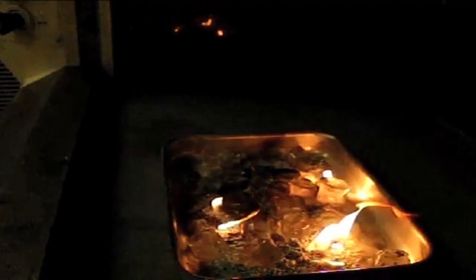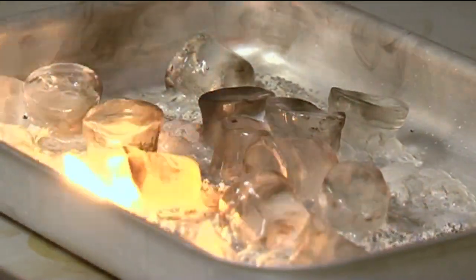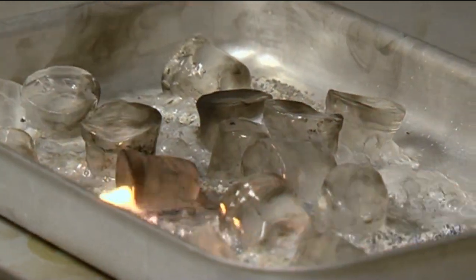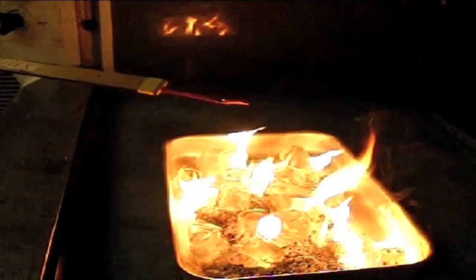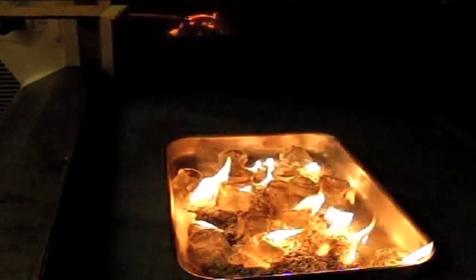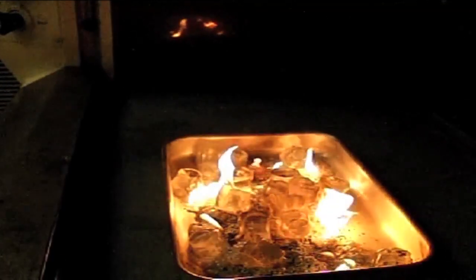Setting off the alarm as well. So the acetylene gas, C₂H₂ — or ethyne, as it's properly known — is the product of this chemical reaction, and all we've done is ignite it. But it does look as if we've set fire to blocks of ice. And acetylene, when it burns, because it is a very carbon-rich compound — C₂H₂ — generates a lot of heat and a very bright flame. It's not as bright as a modern xenon headlight, but in the old days, when people were used to oil lamps, it was pretty bright.